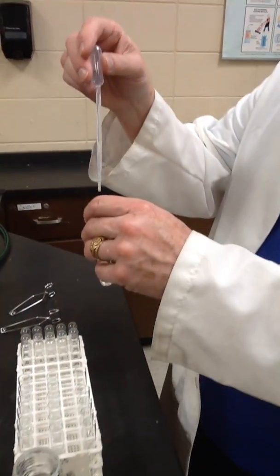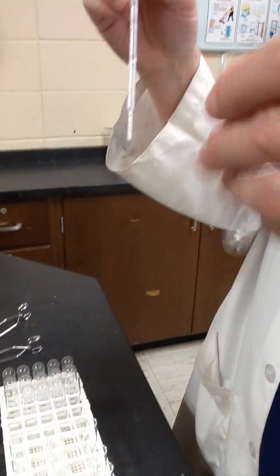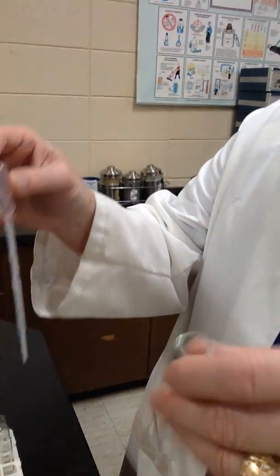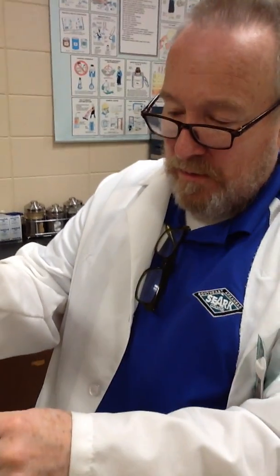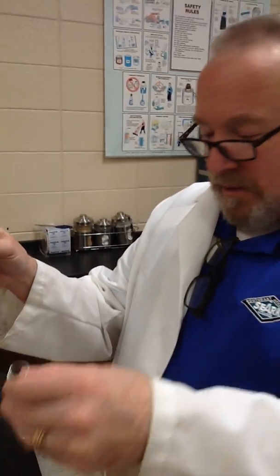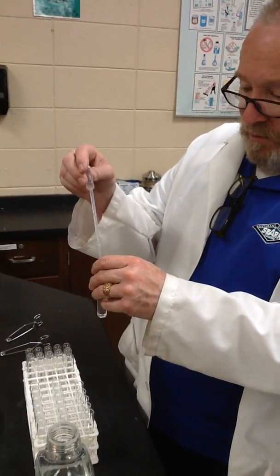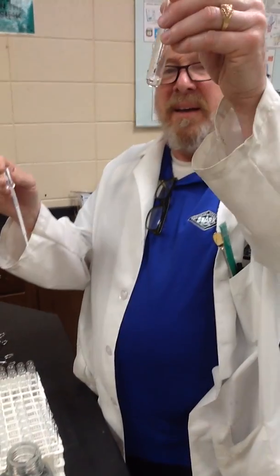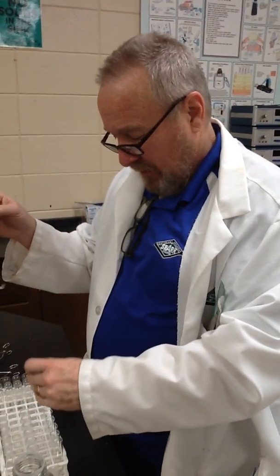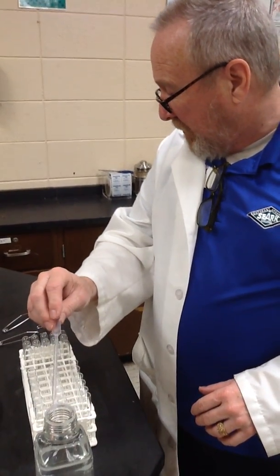Something. Nothing again. 1, 2, 3, 4, 5. It's turned a little cloudy. And 1, 2, 3, 4, 5. It's turned a little cloudy. We'll zoom in on that in a minute.